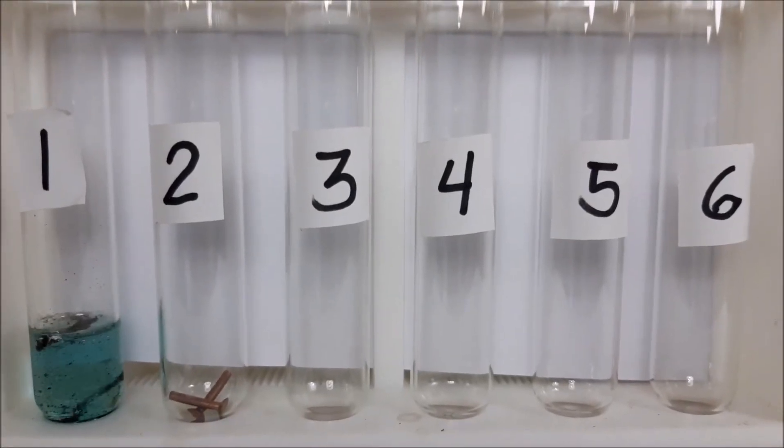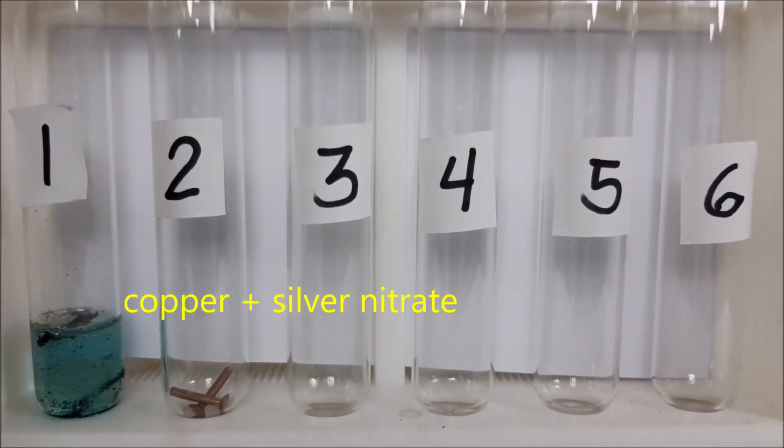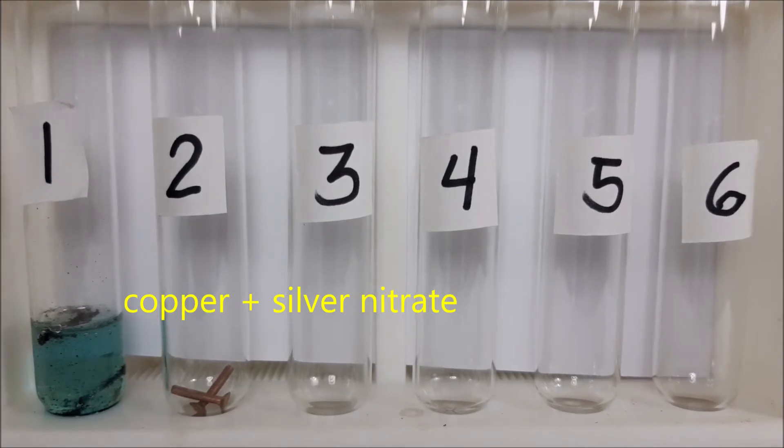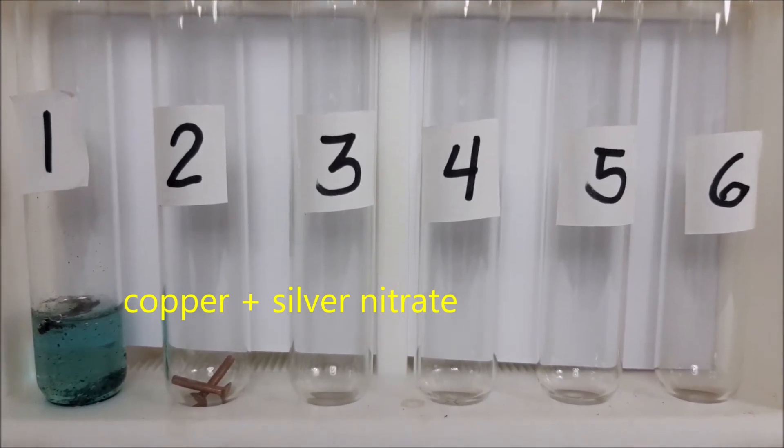For test tube number two, I will put copper and I will put the silver nitrate. Let's see what will happen.